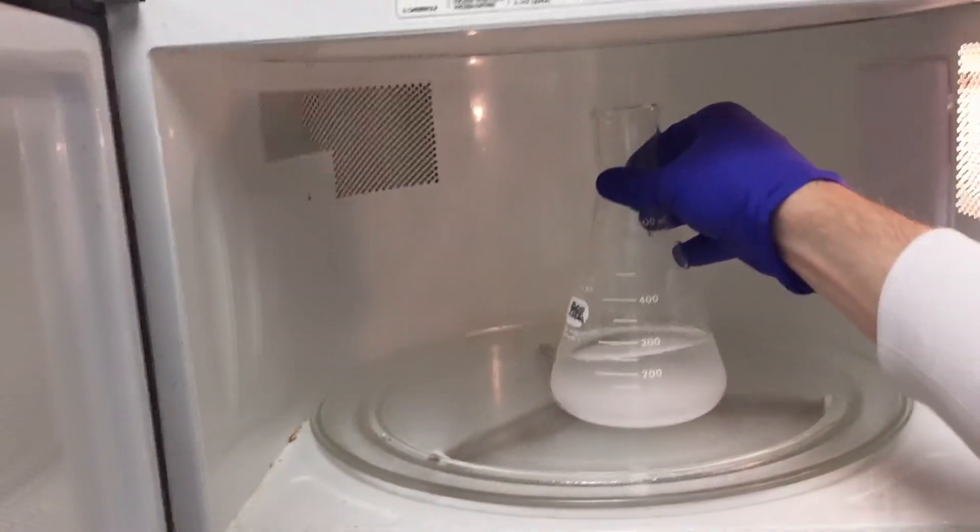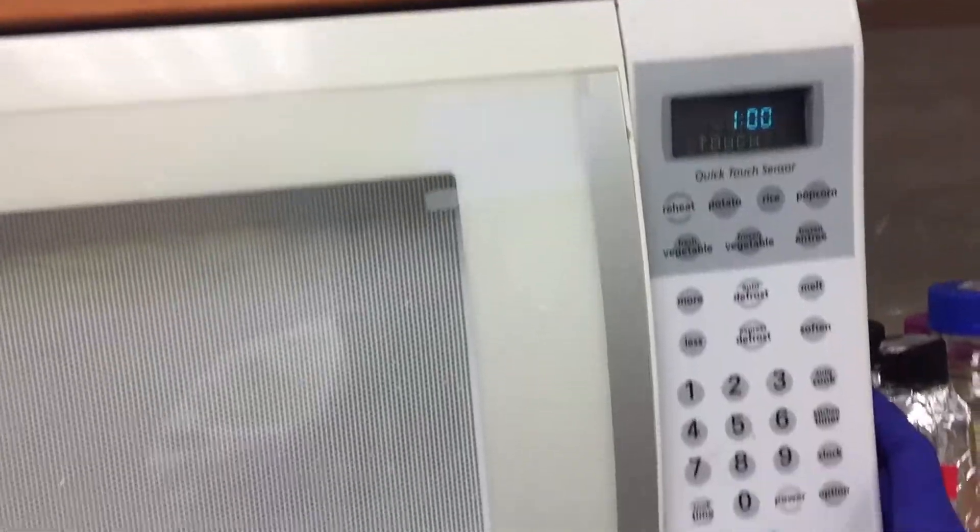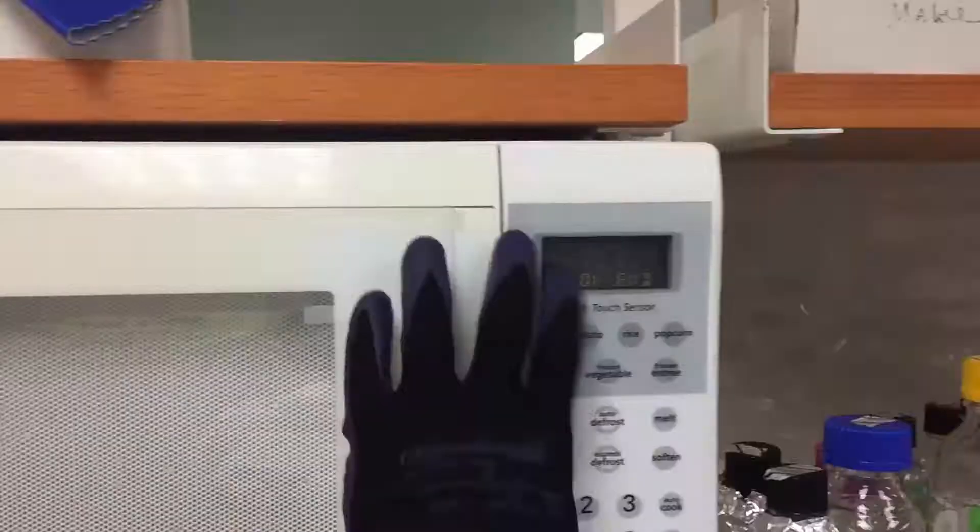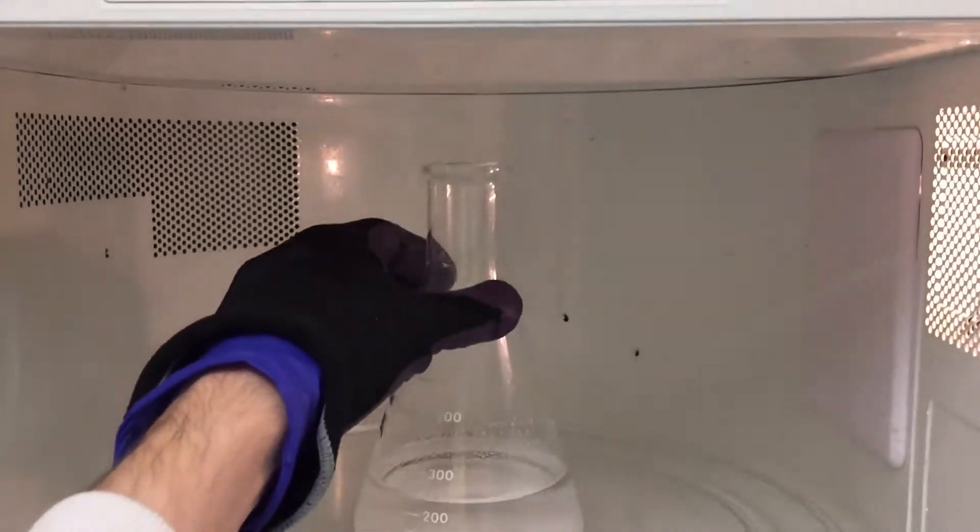You don't want to over boil the solution in the microwave or you'll lose volume and probably end up making a higher percent gel. You just want everything to be dissolved.